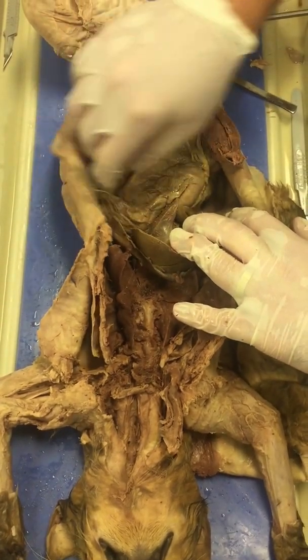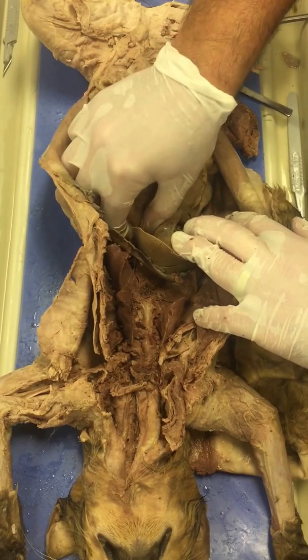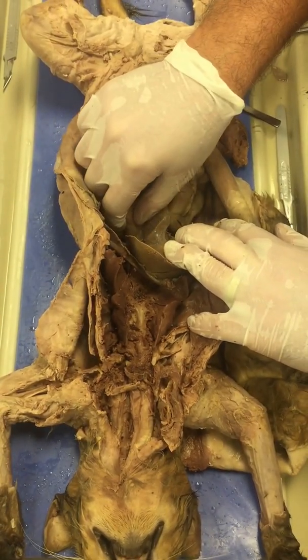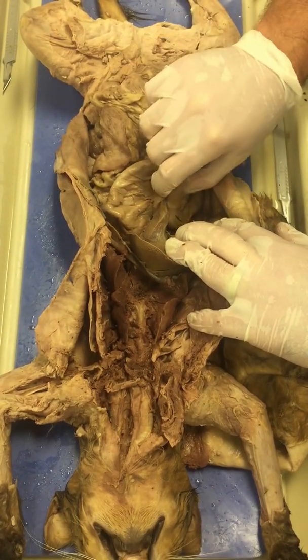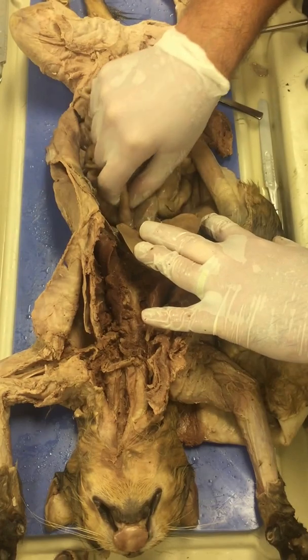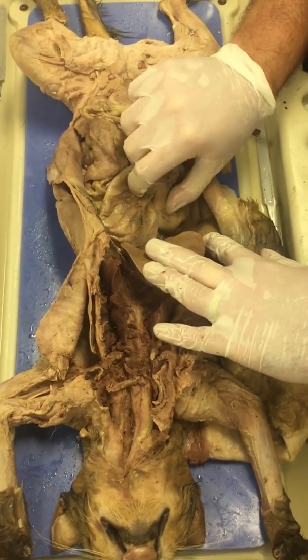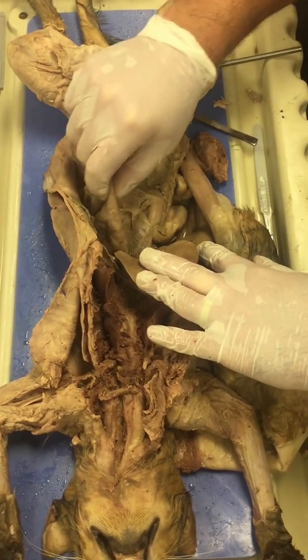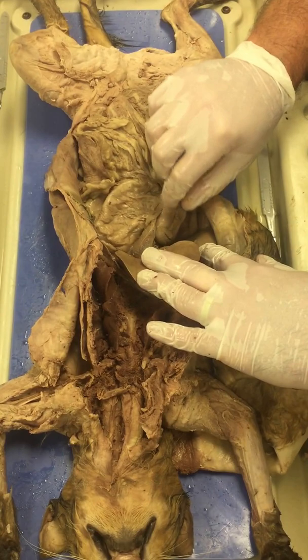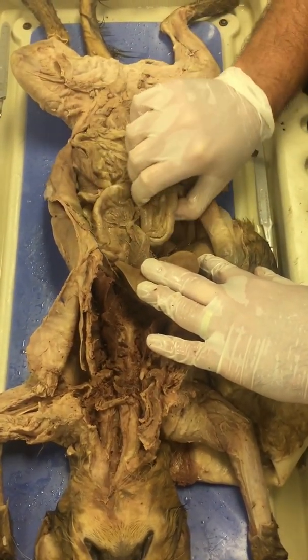So this is the stomach, it's a J-shaped sac. This tight little opening here, this is called the cardiac sphincter. Basically it regulates, or prevents food from going back up the esophagus. In humans, that causes acid reflux or heartburn. So here's the stomach. Remember, the stomach adds hydrochloric acid. It's also pepsin, which helps break down proteins.